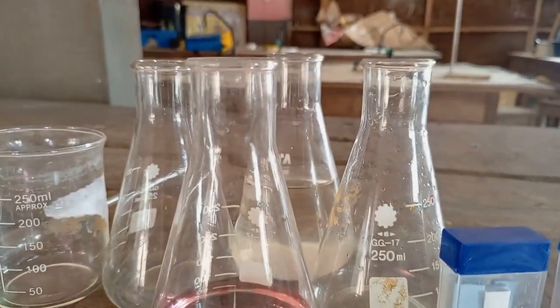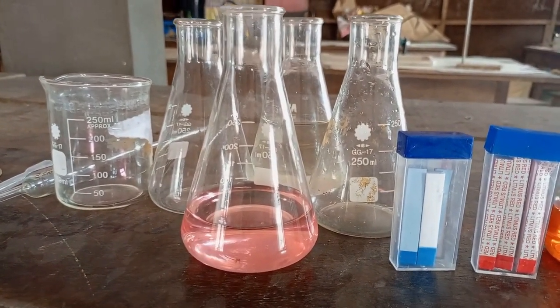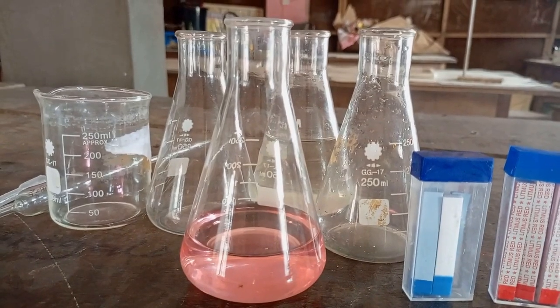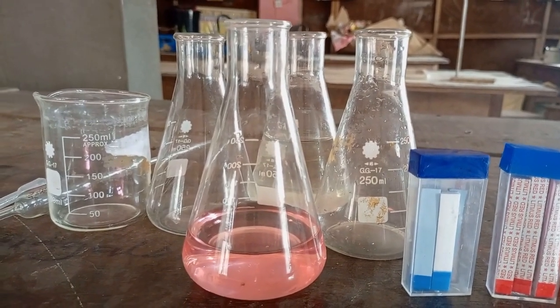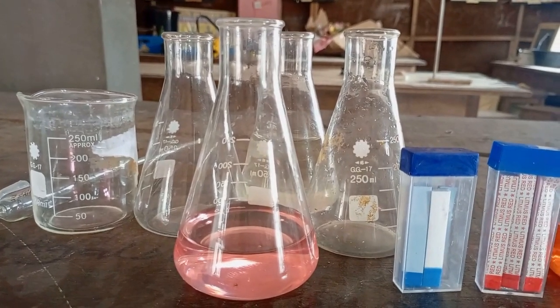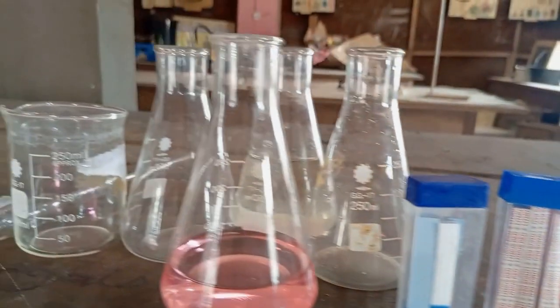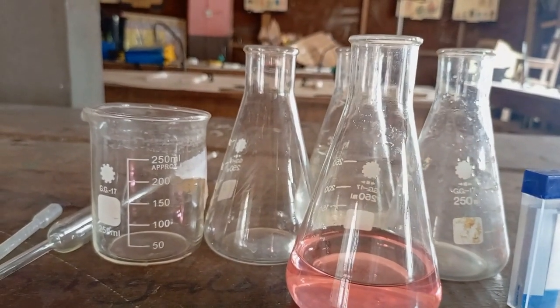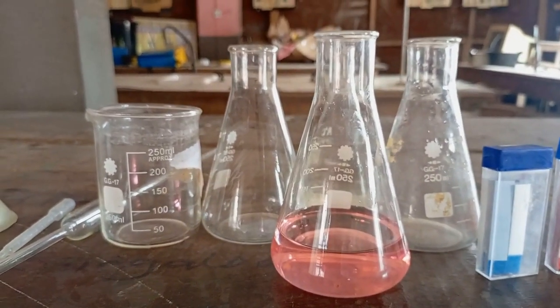Here is my conical flask. You can see after this experiment, the color of the substance in it is pink because this is showing that we have achieved an endpoint. Neutralization has occurred here because acid and base react to form salt and water only. The color change is brought out by the indicator which was introduced in it, in which case we used methyl orange, 2 drops of methyl orange. Make sure you show in your writing the number of drops you use. If you use 2 drops, say you use 2 drops. If you use 3 drops, note there that you use 3 drops.